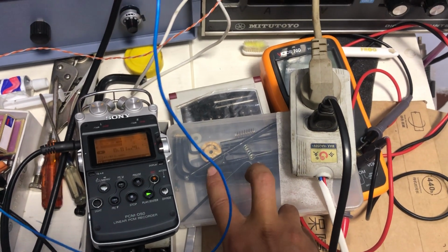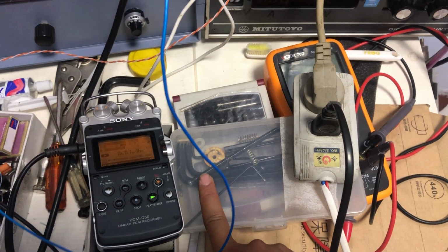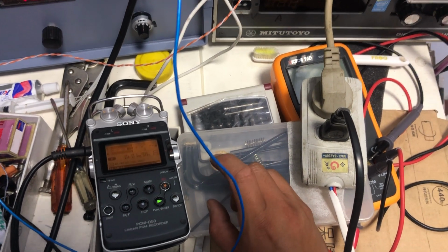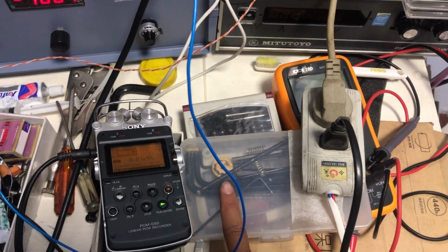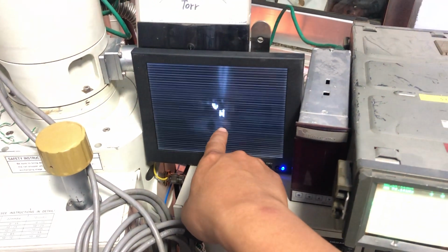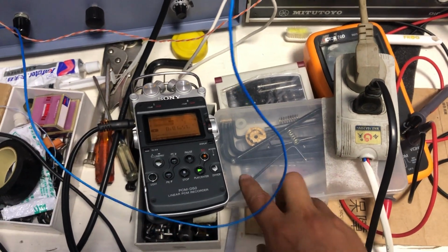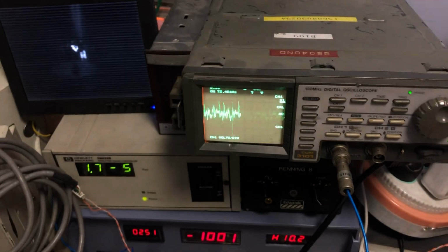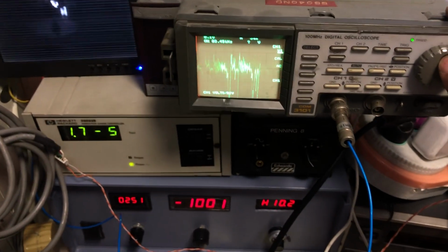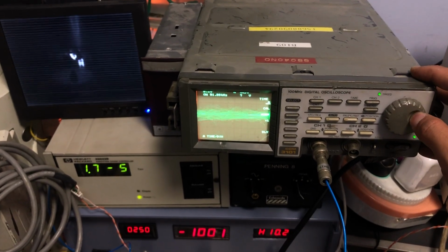The phosphor is not evenly thick enough. So the more thickness of the phosphor, the more brightness, the intensity of the luminance of the phosphor the electron beam turns through. Okay, so that changing is actually the result of the output of the photomultiplier tube.